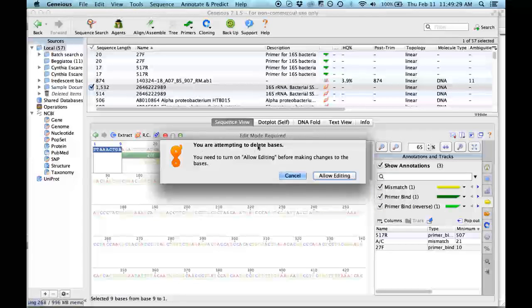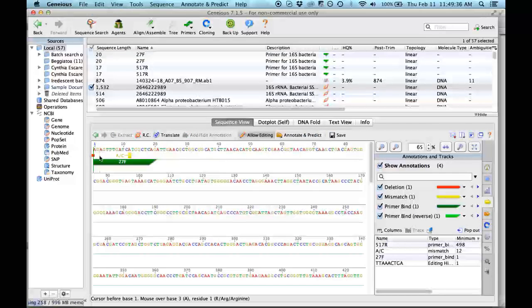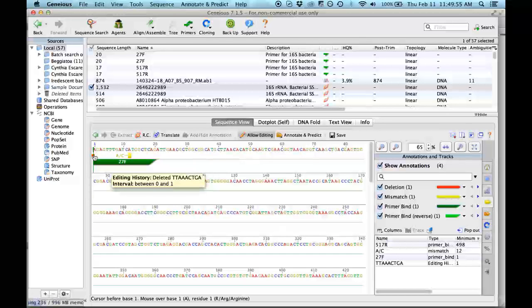You are attempting to delete bases. Yes, you need to turn on allow editing before making changes. So allow editing, and now you see we're starting from the primer. This is another thing when you are working with sequences for a phylogenetic analysis or to upload to a database: you have to remove the primer too. But in this case, because our PCR will for sure have the primer incorporated, we have to include it. Usually you also remove the primer, but in this case, we don't.